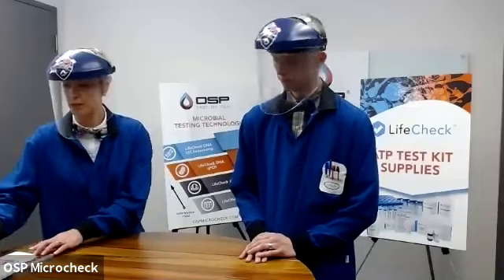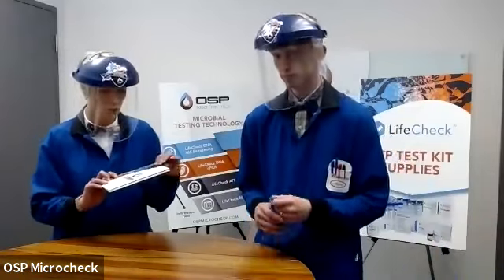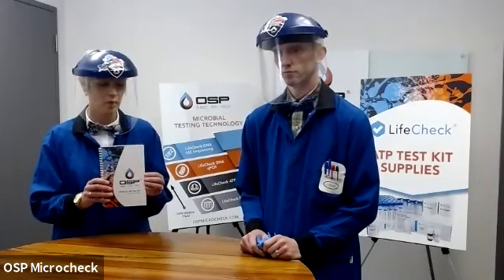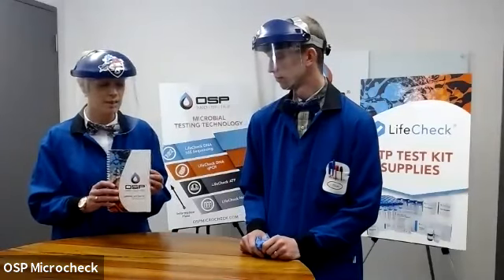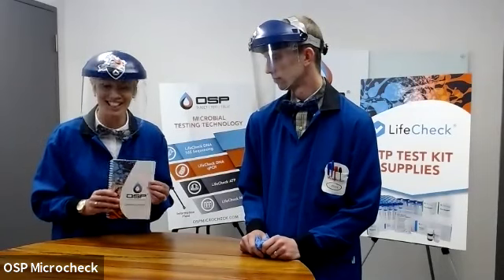So let's go into the ATP testing. We are going to be walking through our procedures. We have an ATP handbook that some people may be familiar with. This does come with some of the components of our kit. We're going to walk through from beginning to end the water testing, the planktonic, meaning we're going to target free-floating microbes. There are 2 versions of this book, so there's going to be some numbering differences if anybody's following along.